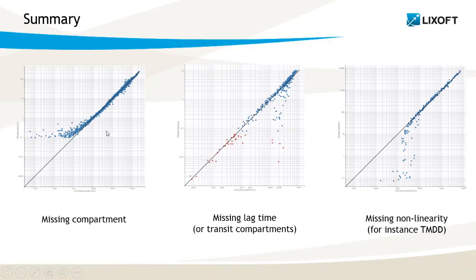To summarize, these are the three typical patterns we can see for PK data. If the deviation is like this, then it is a hint of a missing compartment. If we have a smear like this, it is a hint for a missing T-lag. And a deviation like this, for the small concentration, indicates a probable non-linearity to add to the model.